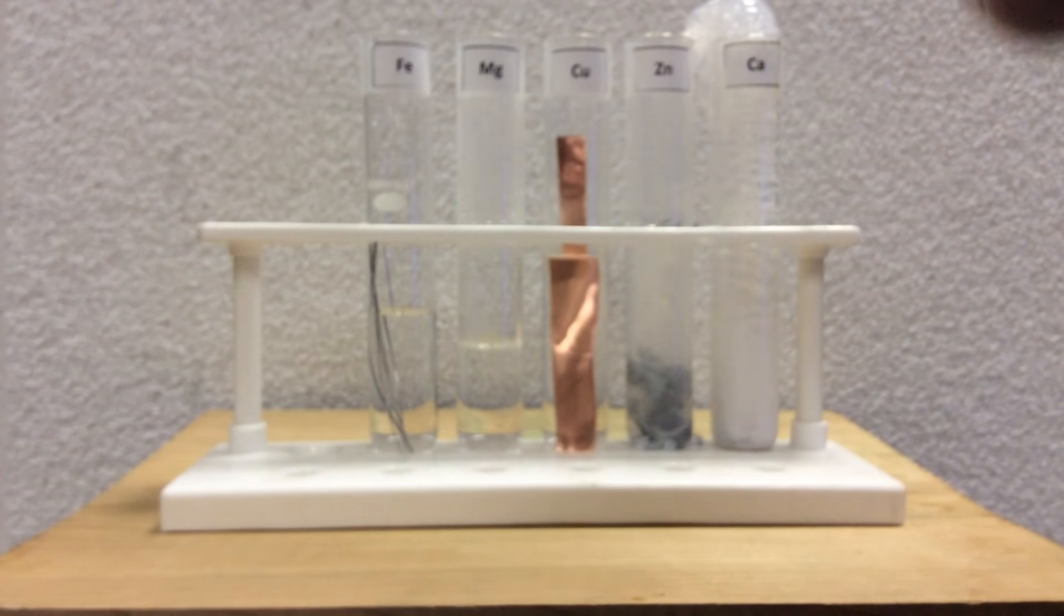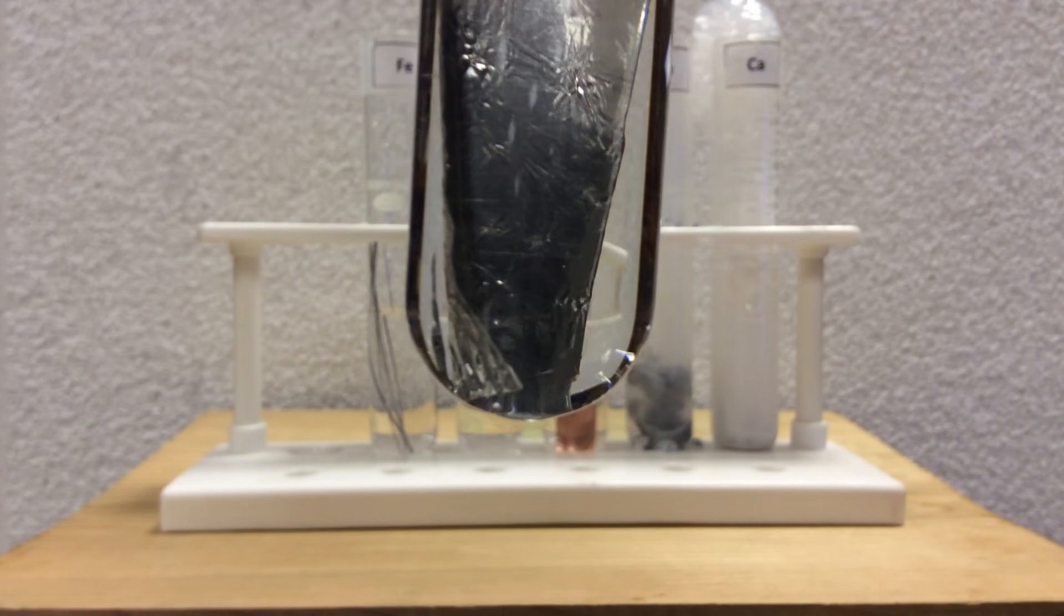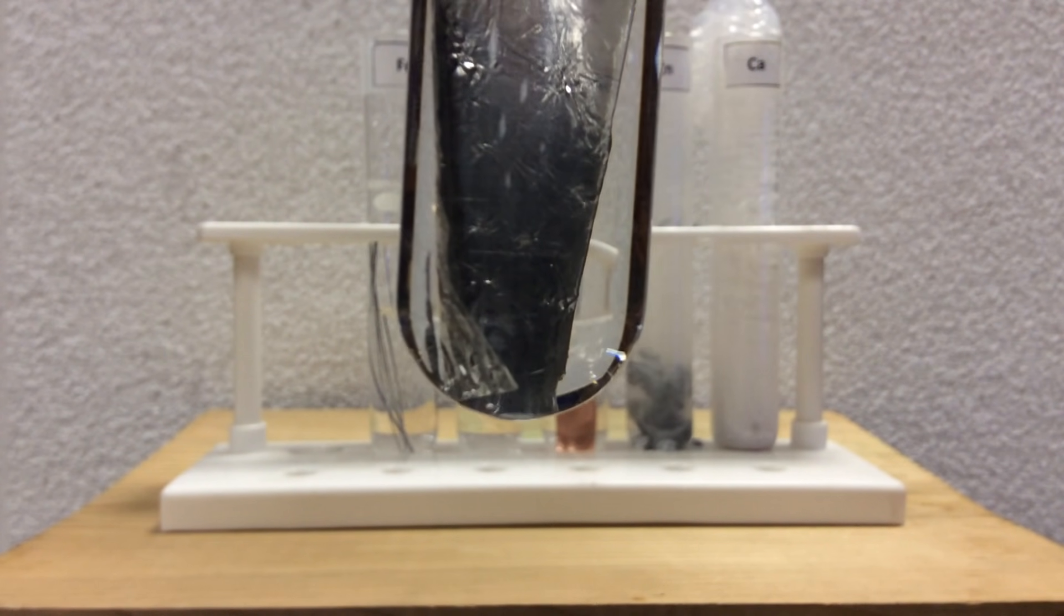Not very vigorous. And then tin, as I come into view here, hard to see much going on here. Very hard to see.